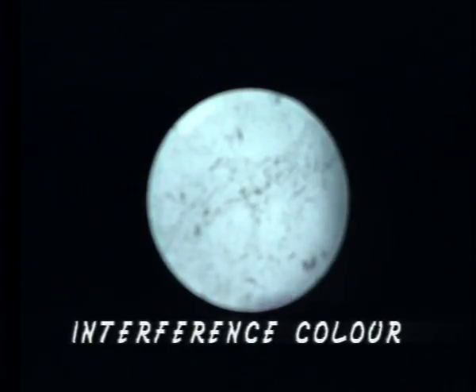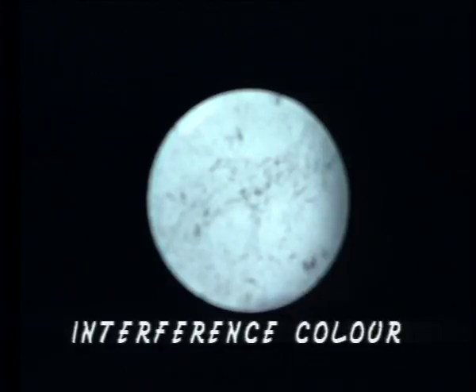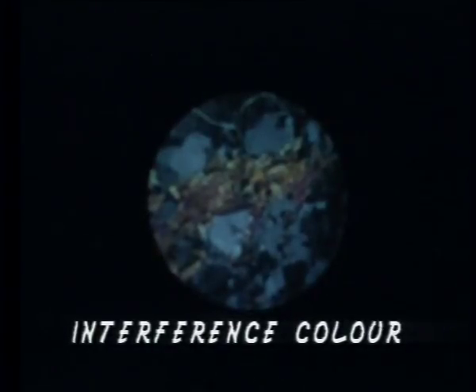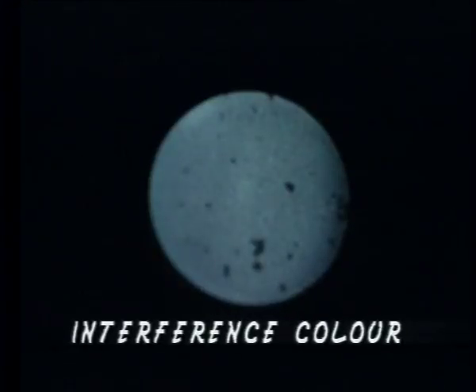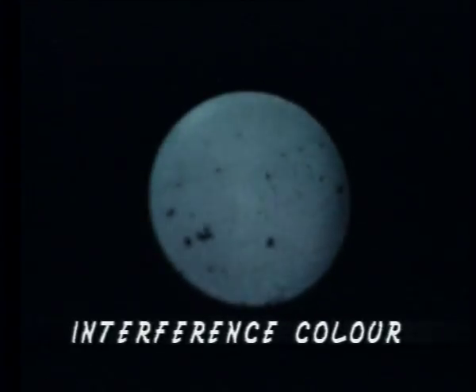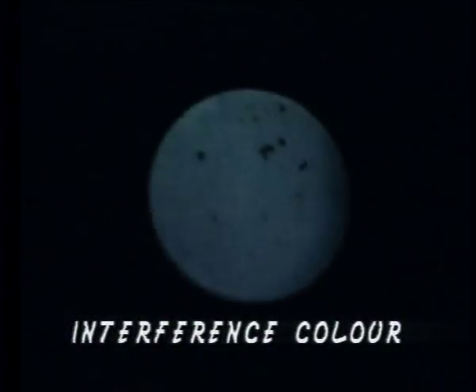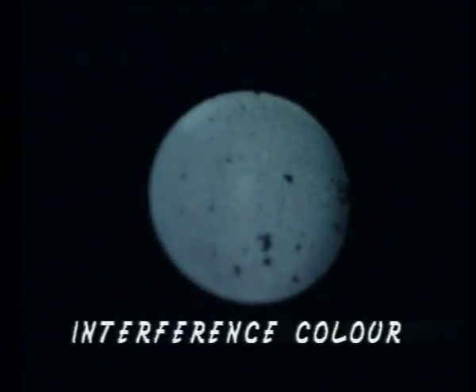Muscovite, which is colorless in plain polarized light, shows brighter interference colors of third order in crossed position. Calcite, having a large birefringence of 0.172, shows fourth order colors.